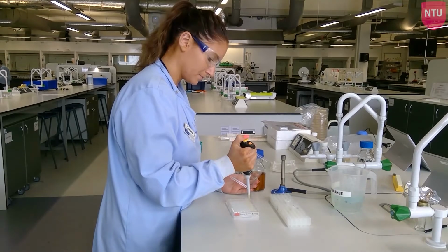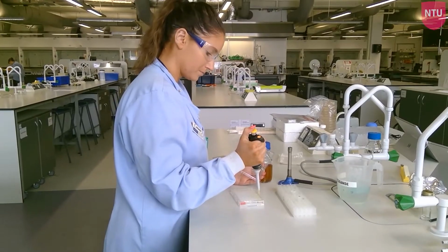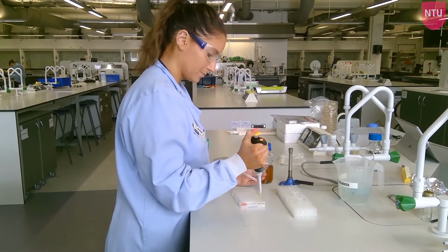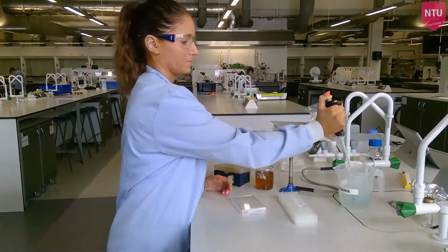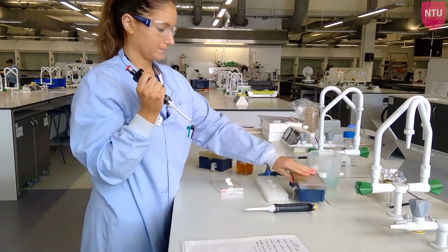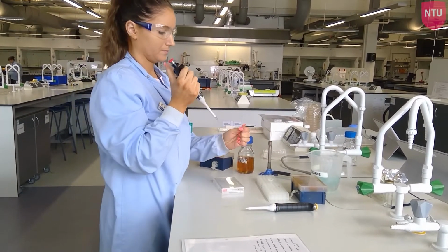When you transfer 100 microlitres of media and antibiotic from well 9 into well 10, you should mix the contents of the well by pipetting up and down a few times. Then remove 100 microlitres of the contents of this well and discard it in a BioCleanse pot. This will give you 100 microlitres of media in all wells, and wells 1 to 10 will contain a twofold dilution in concentration of your antibiotic.